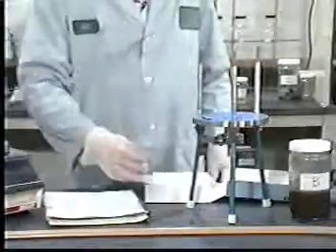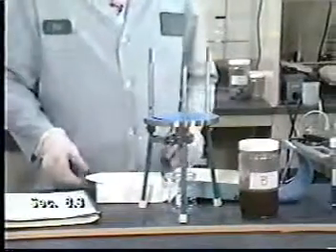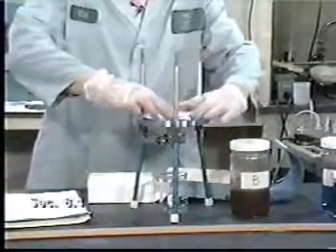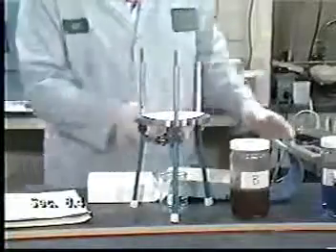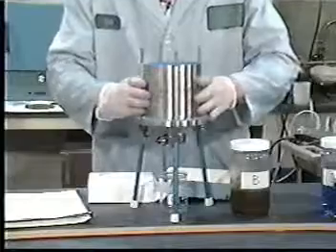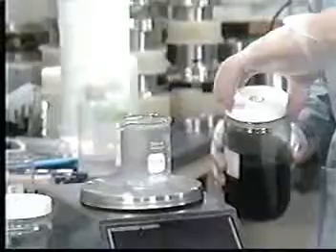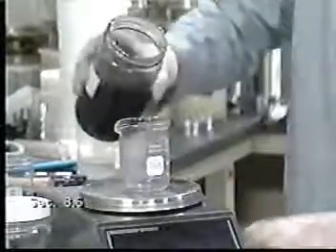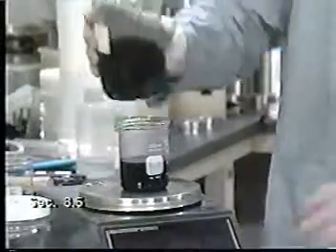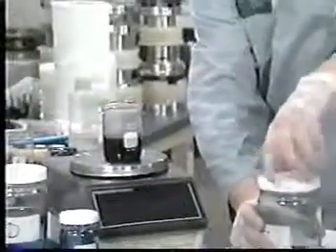For all wastes containing free liquids, filtration is a necessary step. The pre-weighed filtrate collection container is placed under the assembled filtration apparatus. The glass fiber filter has been acid washed and distilled water rinsed prior to use to prevent the filter from contaminating the sample, since metals are of concern here. Place at least 100 grams of the sample into a pre-weighed container. The sample may require homogenization to assure that the subsample to be used is representative. Weigh the container again with the sample in it.